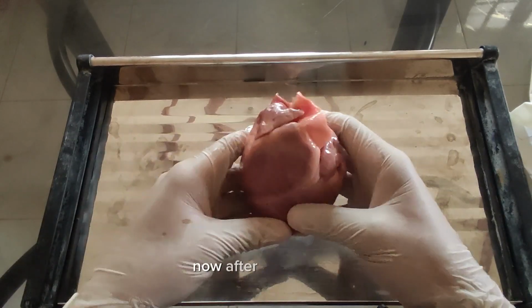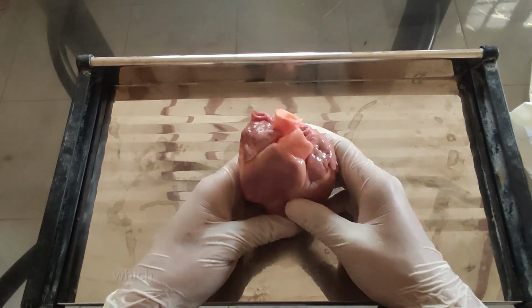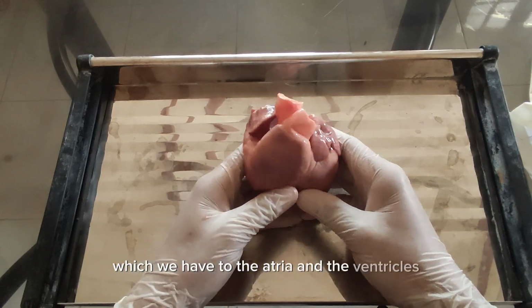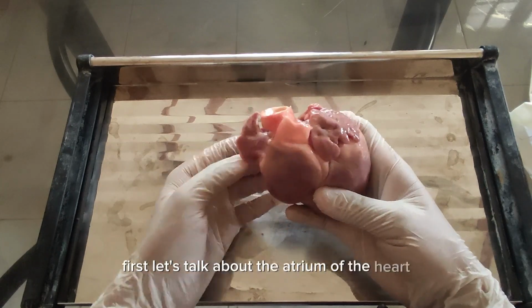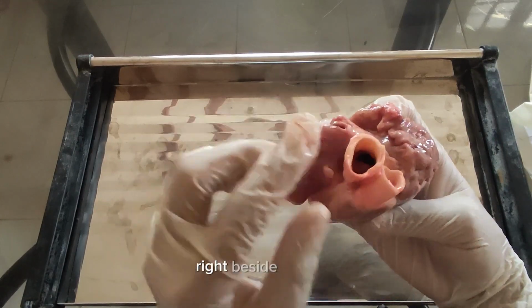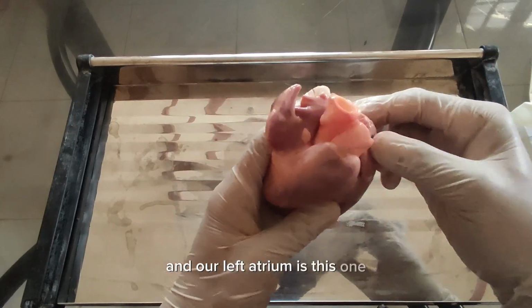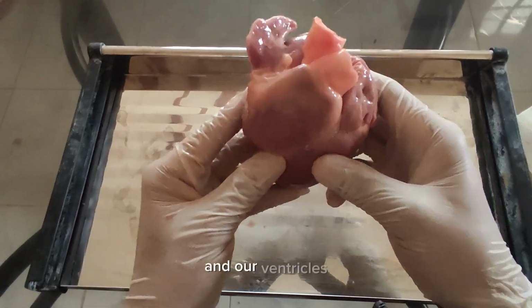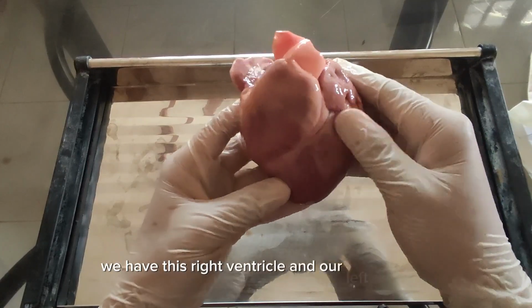Now, after pinpointing the external structure of the heart, let us talk about the four chambers of the heart, which are two atria and two ventricles. First, let's talk about the atrium of the heart. We have the right atrium right here, right beside this one, and our left atrium is this one. And our ventricles, we have this right ventricle and our left ventricle.